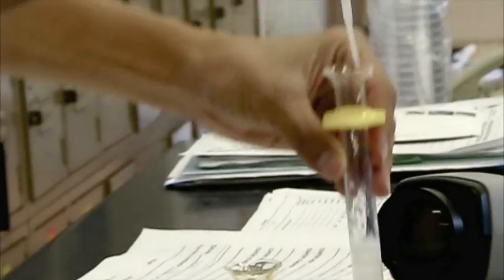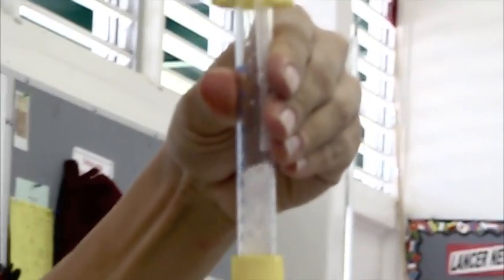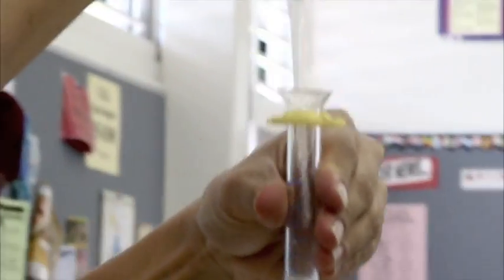And I don't want to contaminate it. So I'm going to get another one to use for the water. I'm just mixing it up so that the cracker is dispersed throughout the whole dish. Now I'm going to wait a few minutes.